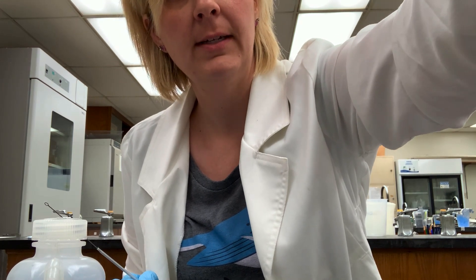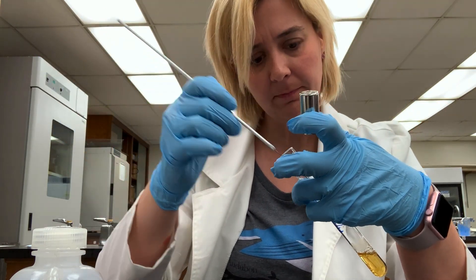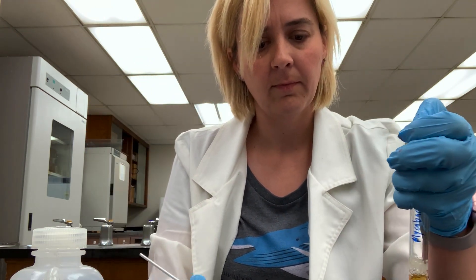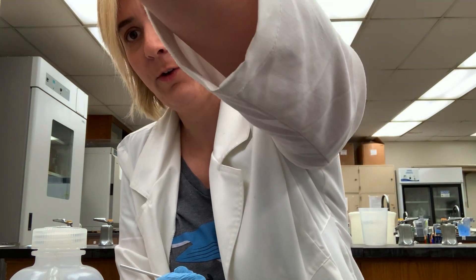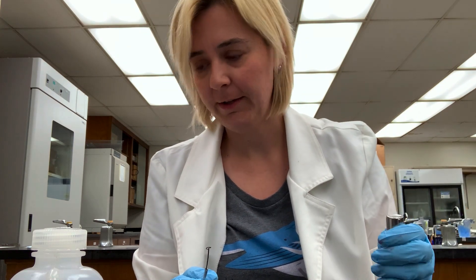The first step in doing an acid-fast stain is to get your cells on the slide. I'll spread those out on the slide, and I'll grab a sample of another kind of bacterium as well. In the lab we're using a safe alternative — definitely not tuberculosis — so only the mycobacterium should stain acid-fast.